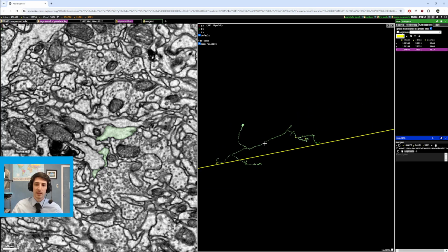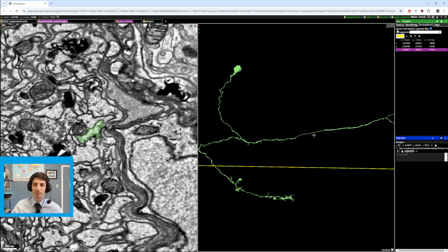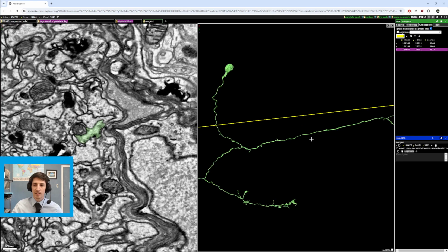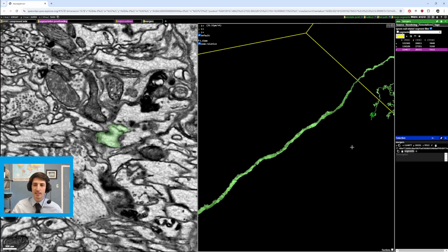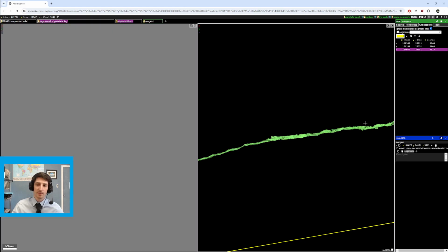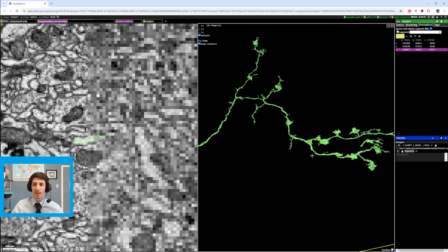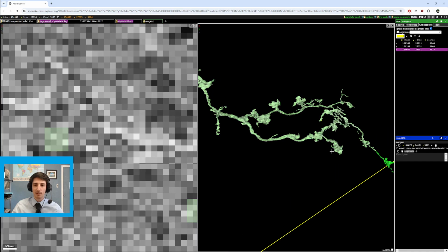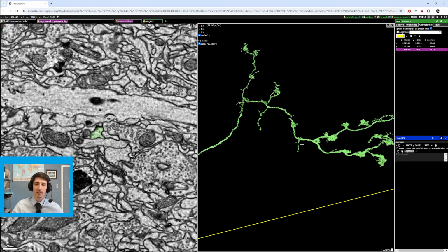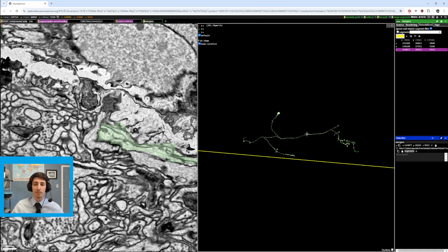So from far away, a little bit hard to tell. And as you can see, if we rotate it like this, it's thin and then thick. But if you rotate it like that, it's thick and then thin. It's hard to tell from a distance these types of things because the branches can pinch and get very thin like that or very flat. But once you zoom in and you kind of get that macro look, it is easier to see the differences in thickness of branches. So those are some of the easier mergers to locate.